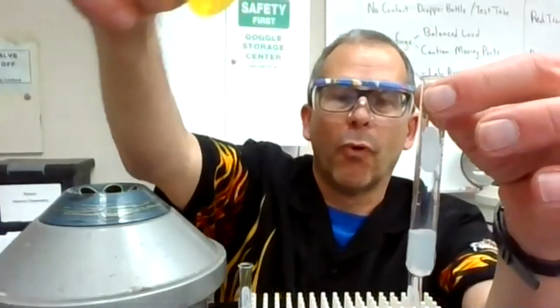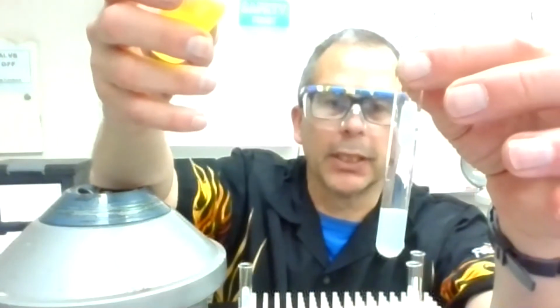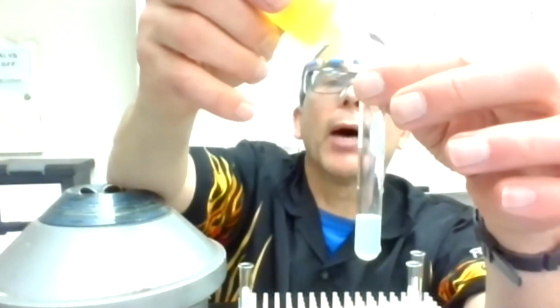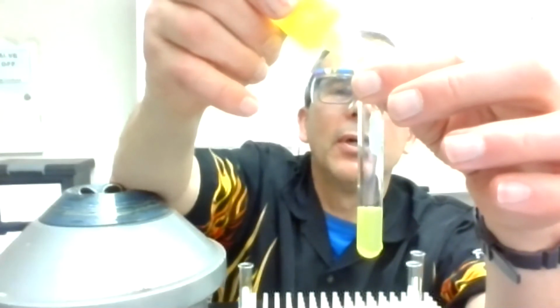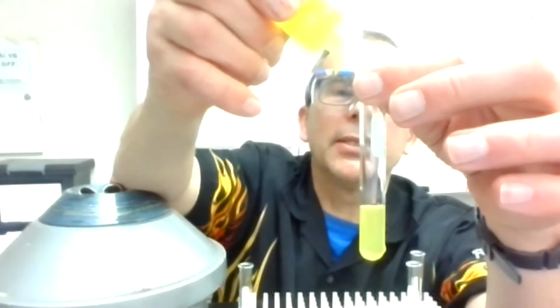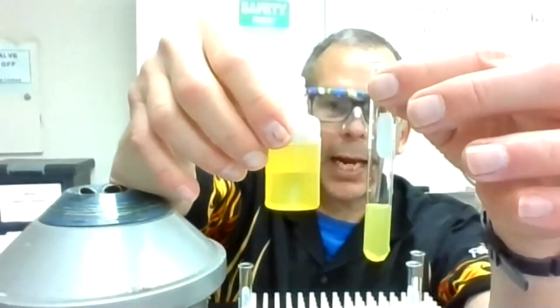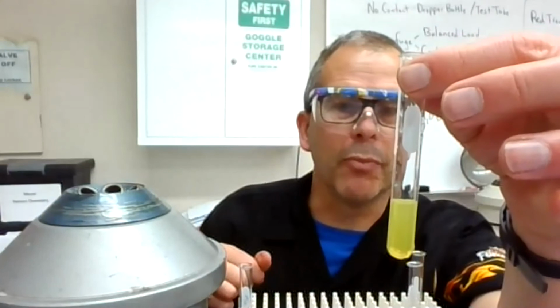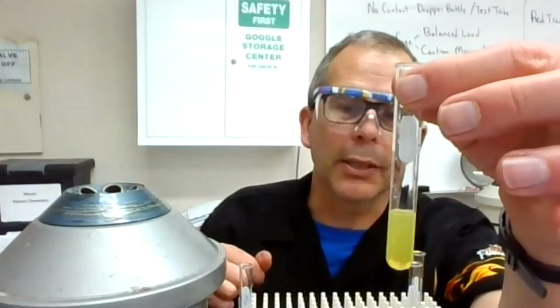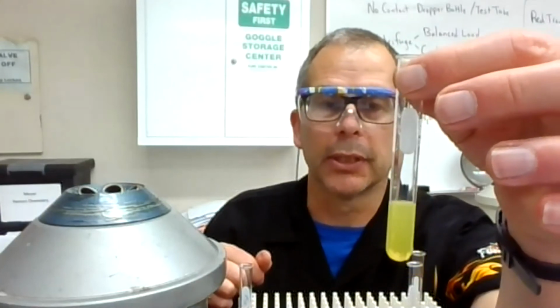When I add CrO4, I should be able to see it. This is a really clear-cut test if it's present. It should get cloudy right away as I add the drops, more cloudy. So as I add the drops, it's getting yellow, and there's haze there, but it's not really additional haze. It's just the haze that I had there from before. Okay, so I would say when I'm adding CrO4, it's not giving me any additional cloudiness. It's pretty clear from here that the CrO4 did not add to the cloudiness that carried over a little bit.